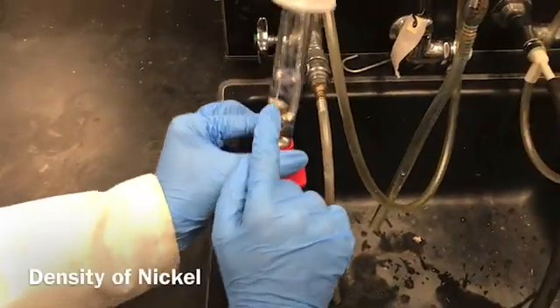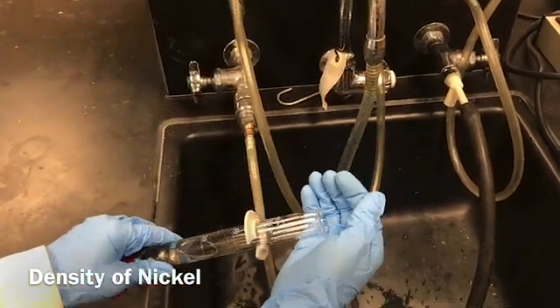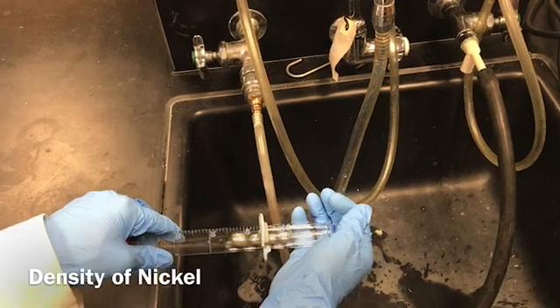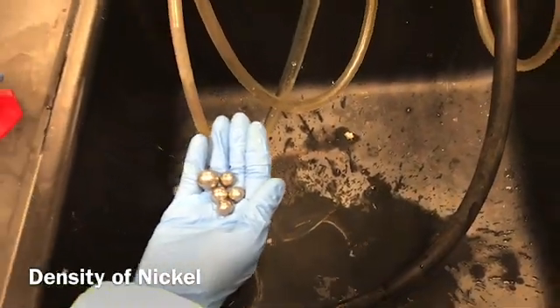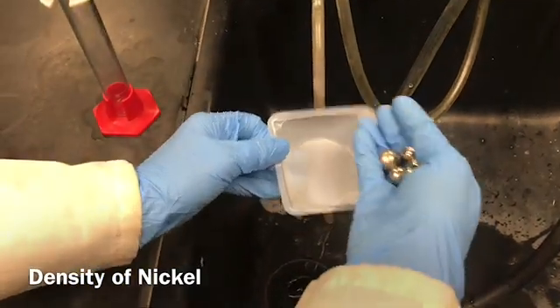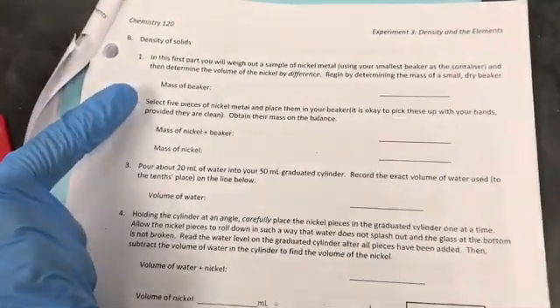When you take out the nickel spheres from the measuring cylinder, make sure you have your hand in front of the measuring cylinder in order to secure the nickel spheres. Otherwise, sometimes they might roll down into the sink and we might lose them. And you can put them in this tray to save them.